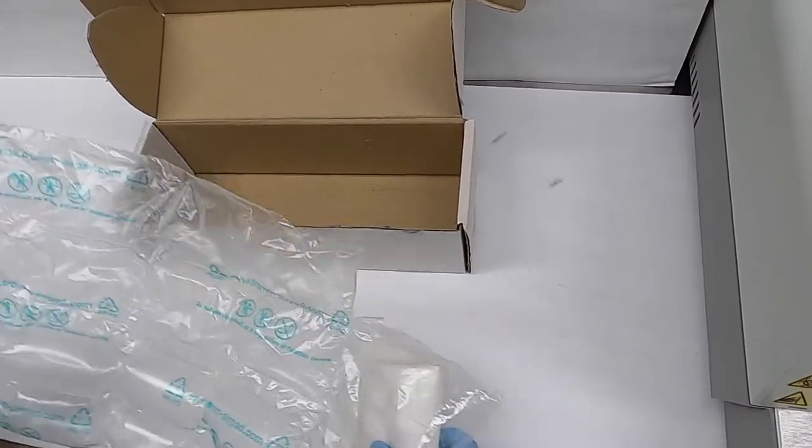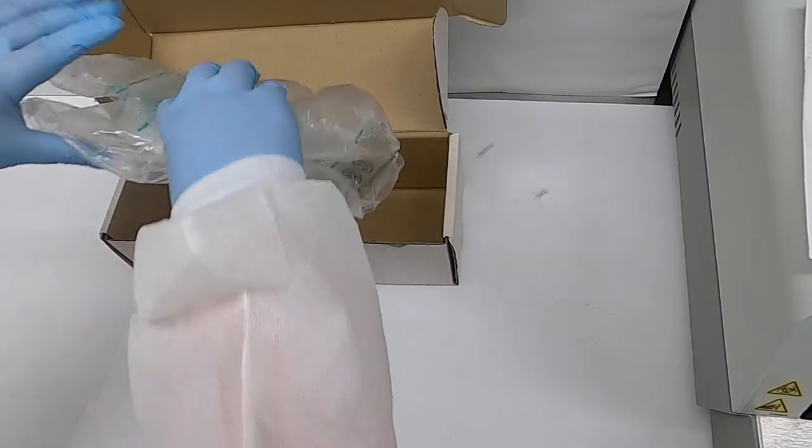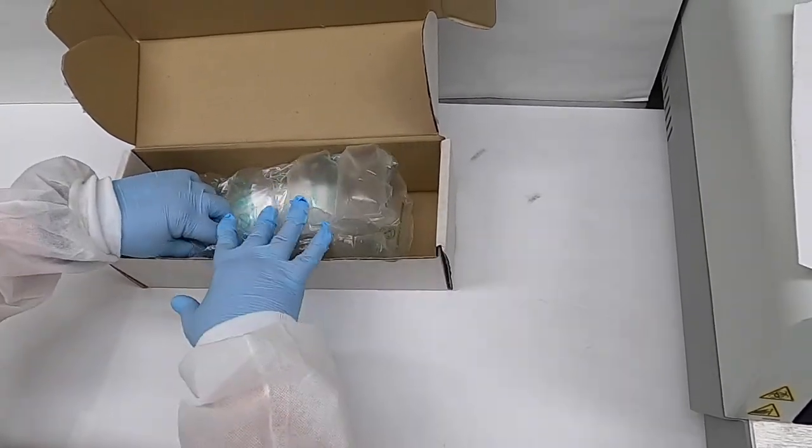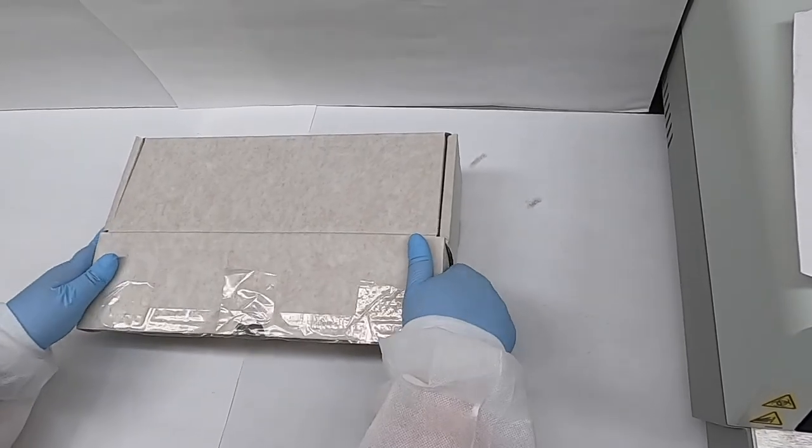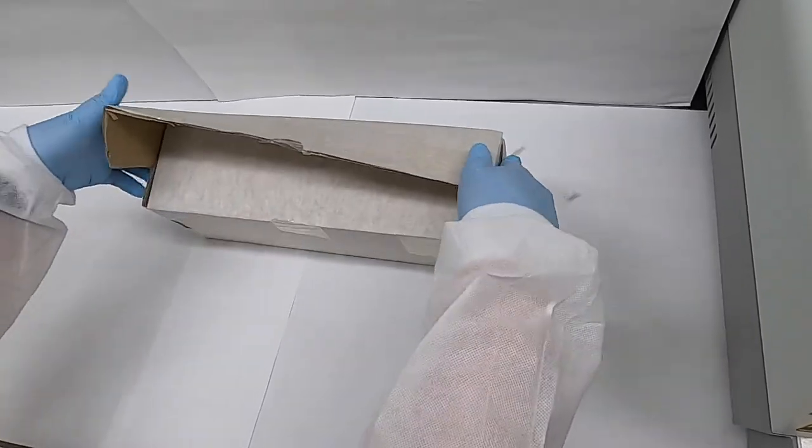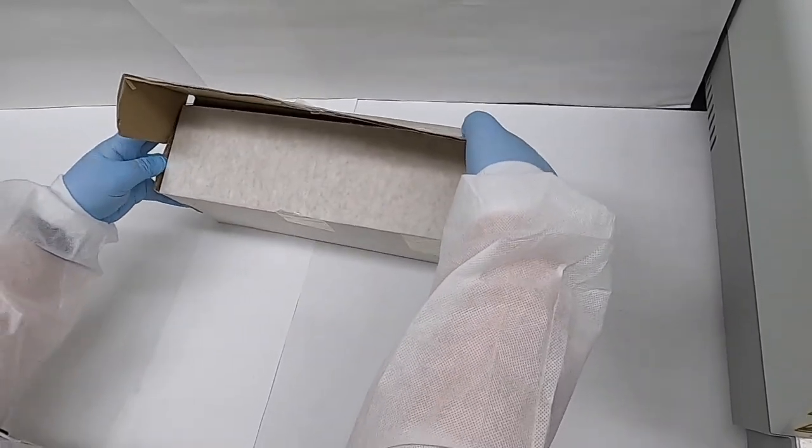In this case, for an added layer of protection, we've added these air-filled packaging pillows to keep our sample safe. It's then loaded into a sturdy cardboard box, which is sealed and prepared for shipment to the laboratory.